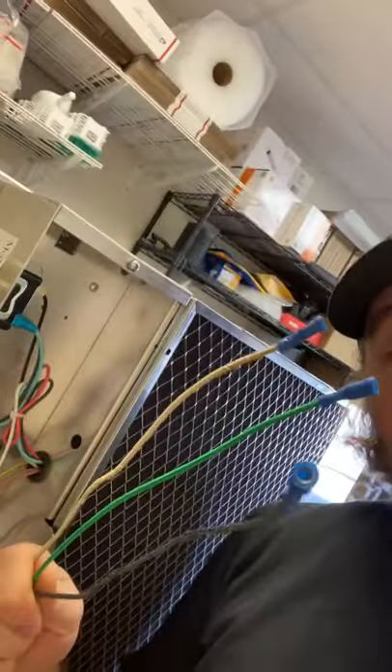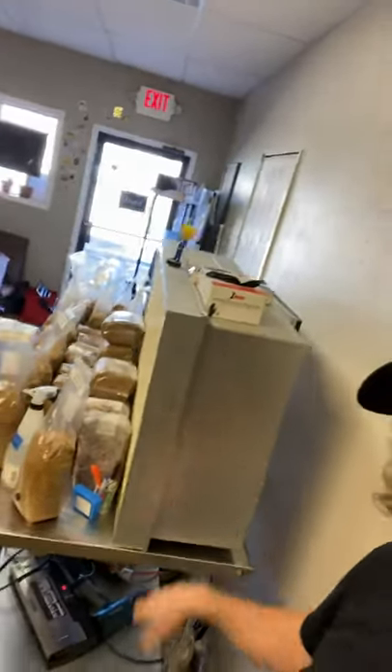They come in two power modes: 120 or 220 volt. I've only got access to 120 on this side, so I've got the 120 model. When they pull these out of labs, if you don't buy a new one — if you get a new one, it'll probably come in two boxes with the filter separated and you'll assemble it. This was actually removed from a clean room, from a laboratory. They popped the power off — easy fix. I'm going to go to the hardware store and with these tools, I'm going to get an extension cable and make a new 120-volt power cable. After I'm done, I will happily have another four feet of flow hood space.